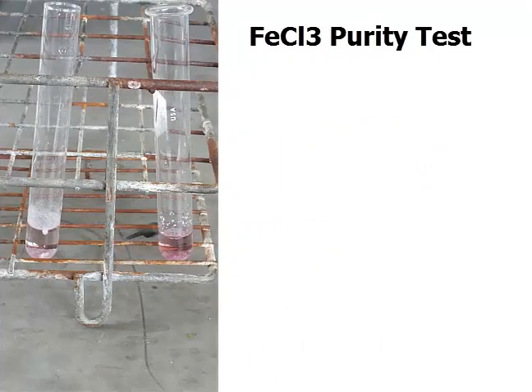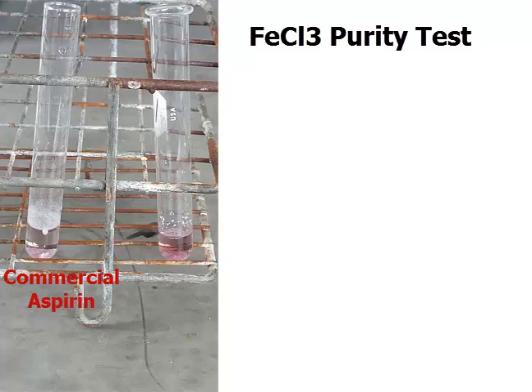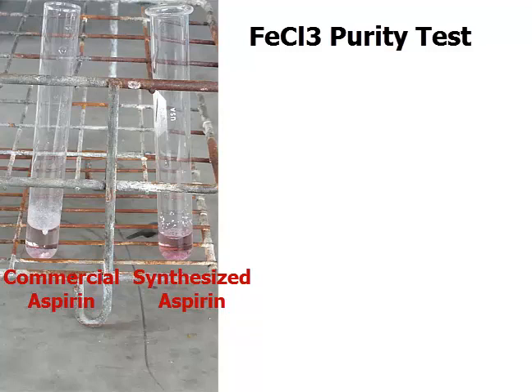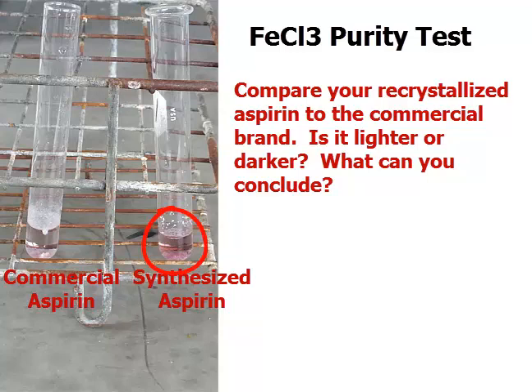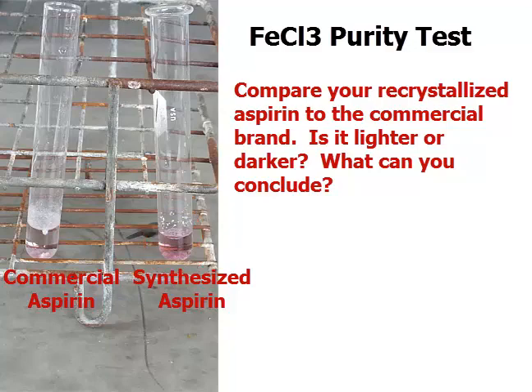Here's an example of what the actual purity test looks like. On the left is commercial aspirin and on the right is synthesized aspirin. We expect the synthesized aspirin to be a little bit darker because the quality and purity standards are not as rigorous in an organic chemistry lab as they would be at Bayer or another aspirin manufacturer. You can see in this example the synthesized aspirin is slightly darker. We'll compare what we purify to the commercial brand and ask: is it lighter or darker, and is it less pure or as pure as commercial aspirin?